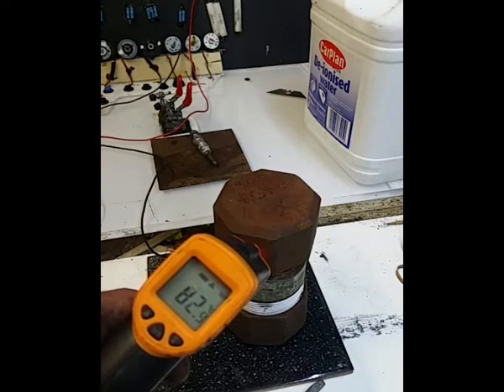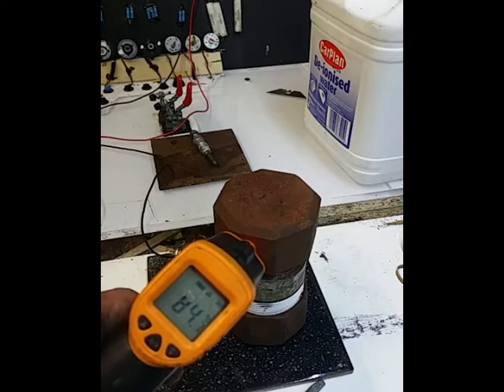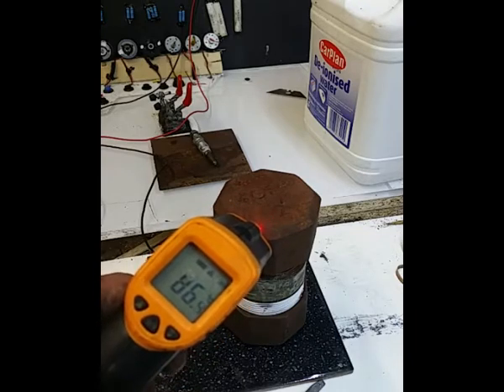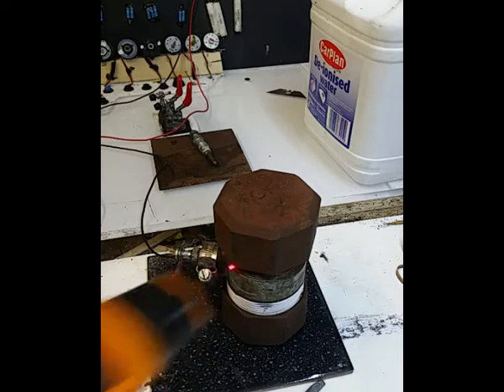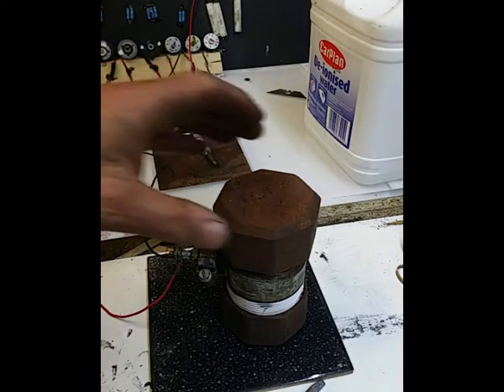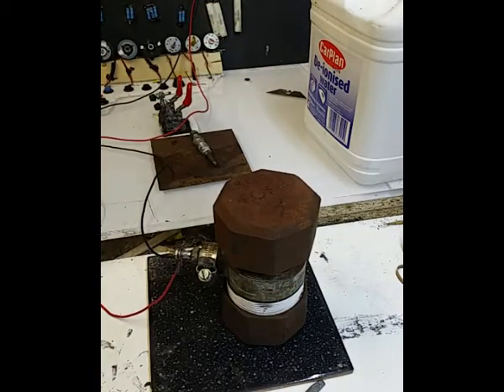And we've got, wow, 83 degrees, 84 degrees. Now that's on the top. Okay, so that's centigrade, obviously. Wow, that has worked really quickly. Now that is hot now. So we're still at 6.3 volts, and we're down to 5.8 amps.